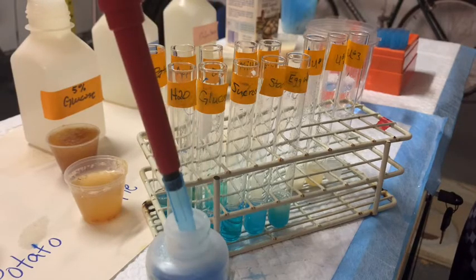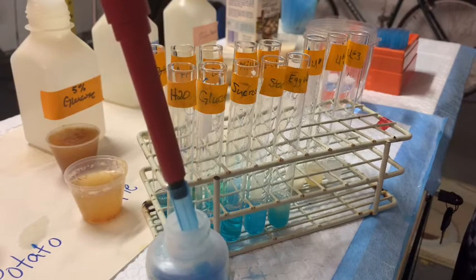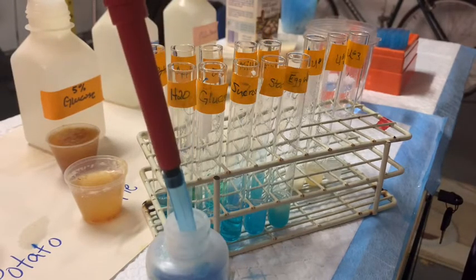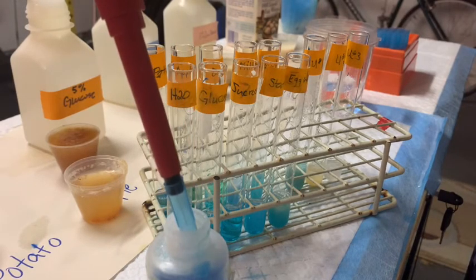The heat will also break up sucrose into glucose and fructose. We'll be able to see the reaction after we heat it, so I'm going to add these in, then take these tubes and put them in a pot of boiling water in my kitchen.